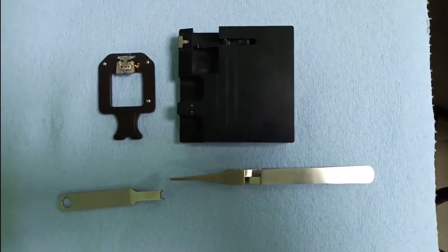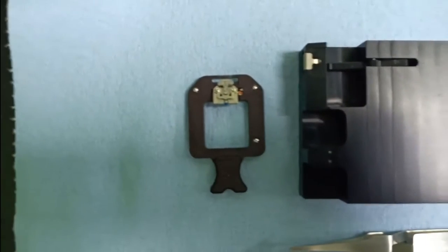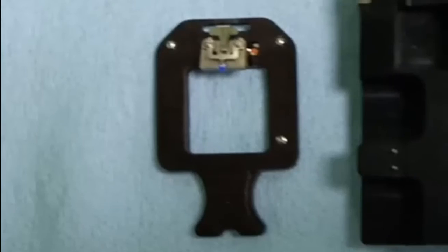The main parts of this holder sample are the holder of the cantilever. As you can see, this holder has the cantilever, which is the main part of the scanning, in which a tip, as you can see in the image, can scan the sample directly.